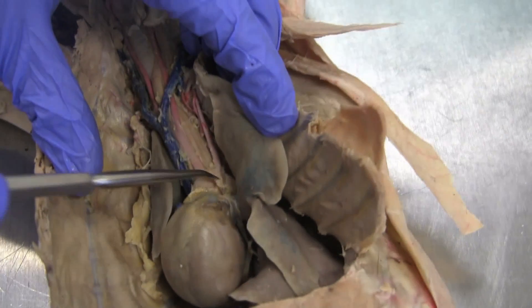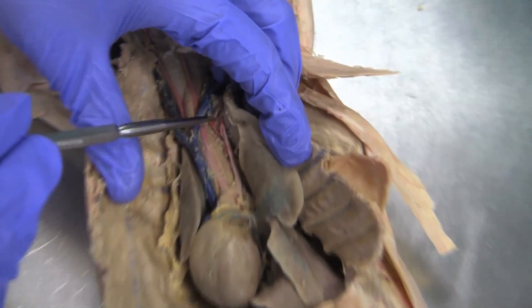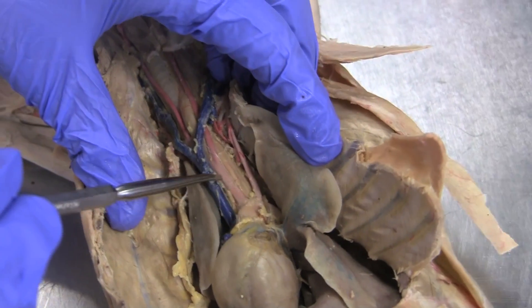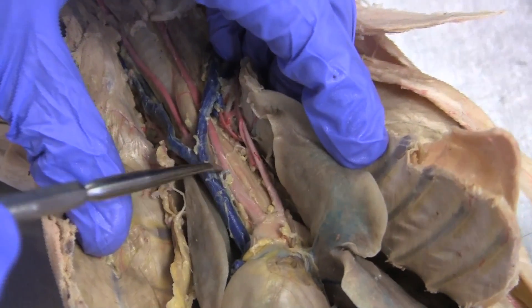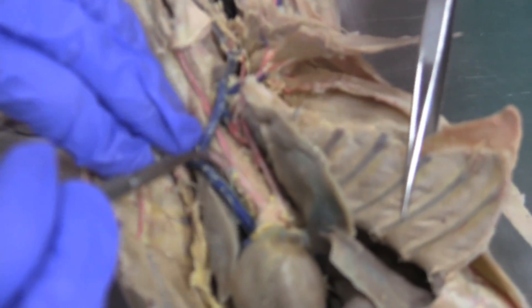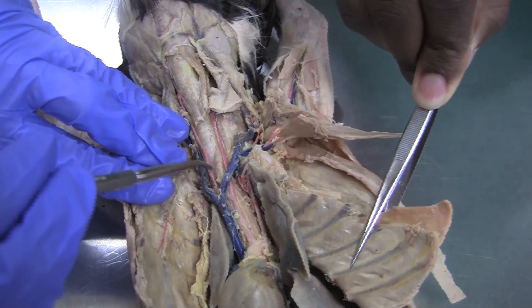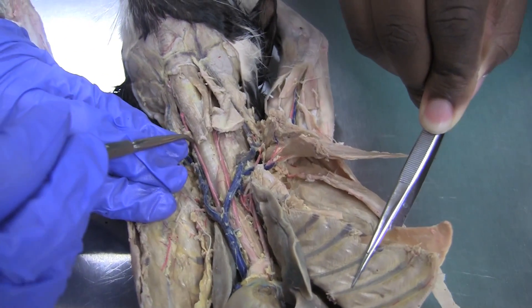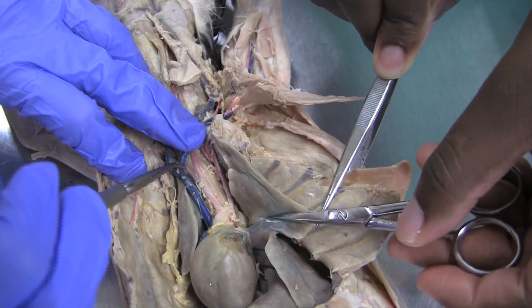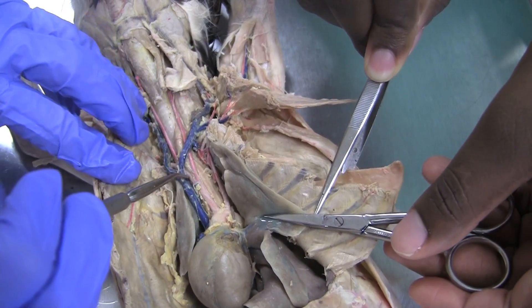Okay, aortic arch, and then we'll go up the right side of the arteries first before the left side. So this is your brachiocephalic artery, then branching off your brachiocephalic artery, you've got your left common carotid, and then you've got your right common carotid artery, and then this turns into your right subclavian artery.